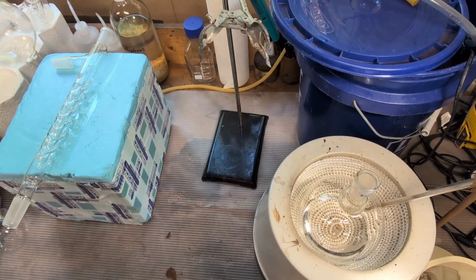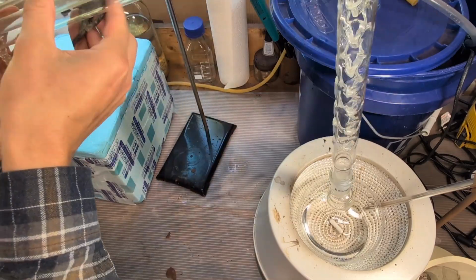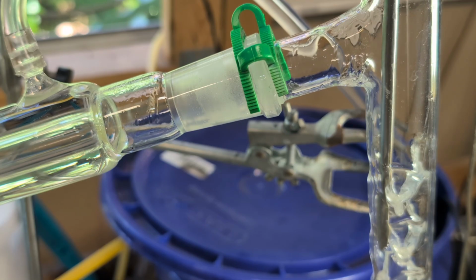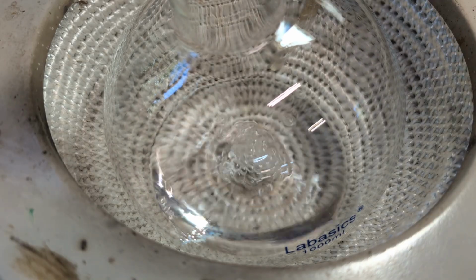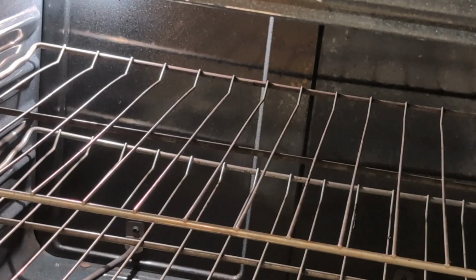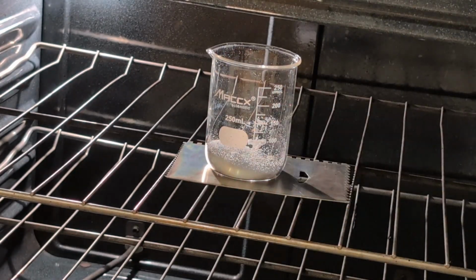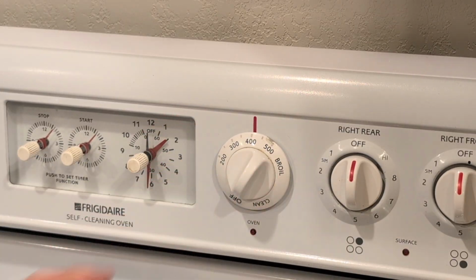I immediately set it up for a second fractional distillation, this time placing the heating mantle thermometer probe at the top of the fractionating column, so that the thermostat would only let through vapors with a boiling point below 50 degrees Celsius. At the same time, I prepare a drying agent by baking 25 grams of calcium chloride at 200 degrees centigrade, driving off any absorbed moisture before it's used to dry the ether.